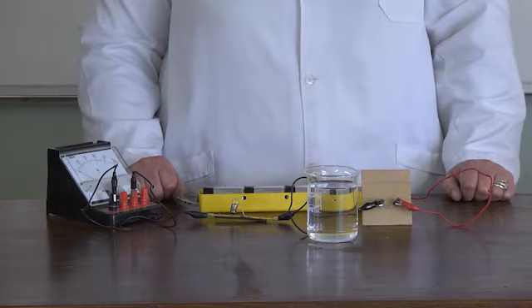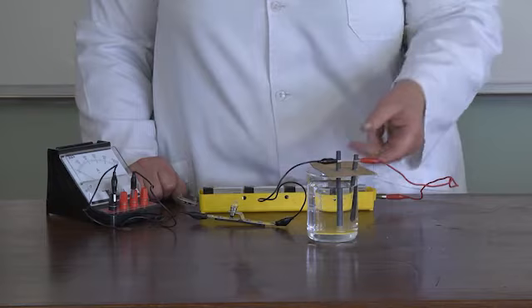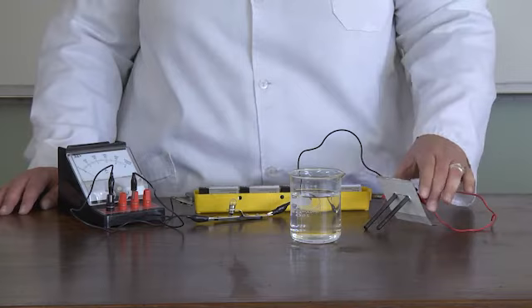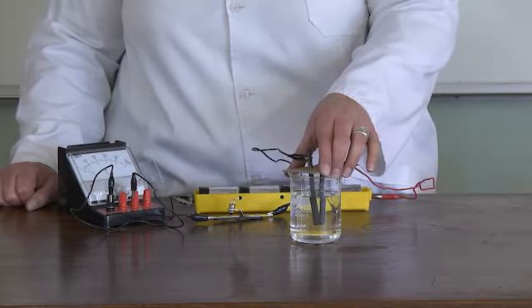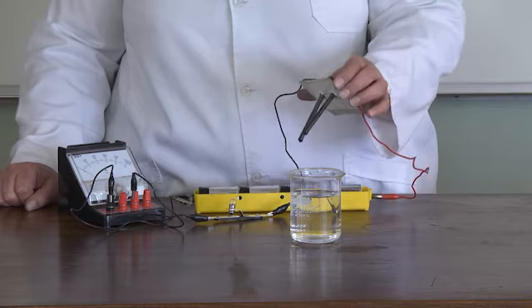Now test the conductivity of liquids. Place the electrodes in distilled water and observe what happens — no current is flowing. Place the electrodes in tap water. The ammeter indicates that a current is flowing; however, the light bulb doesn't glow because the current is very small. Disconnect the apparatus after every test and rinse the electrodes off with distilled water. Dry the electrodes with a paper towel.